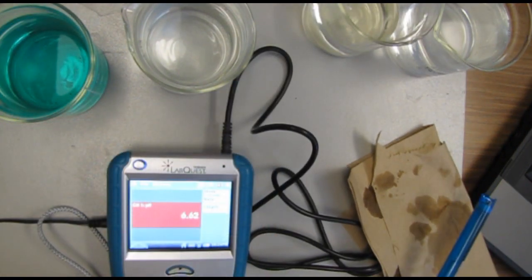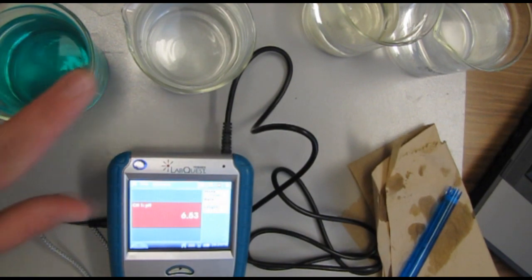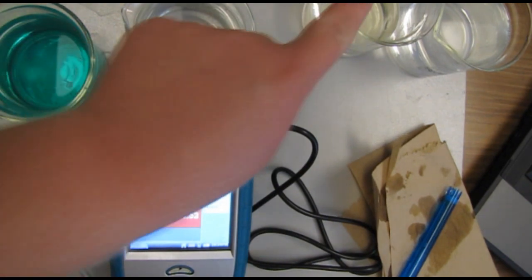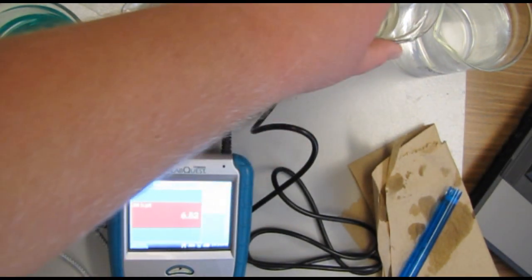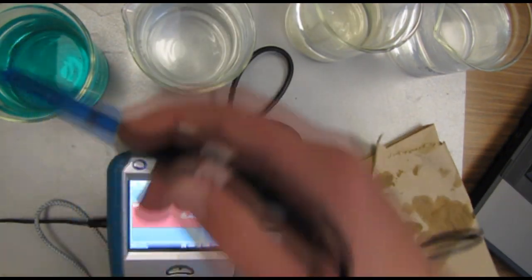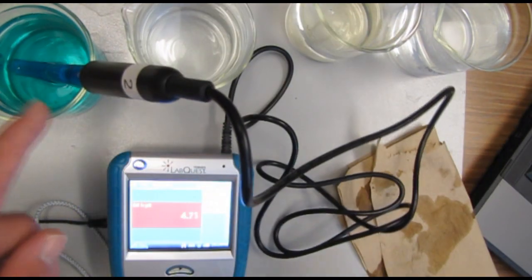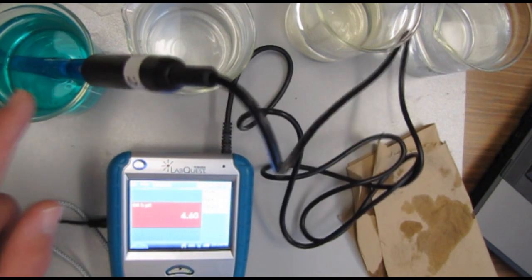Okay, so I'm going to have Listerine, vinegar, dishwashing liquid, and distilled water. First I'm going to stick it into the Listerine mouthwash.